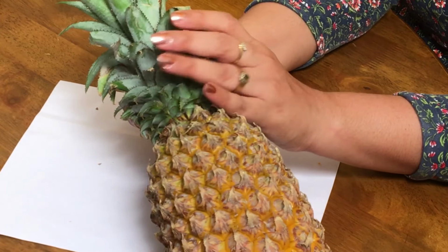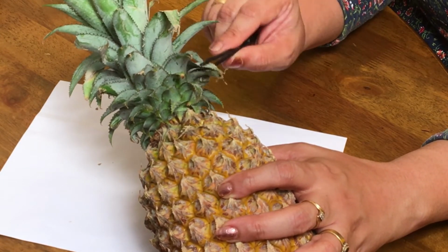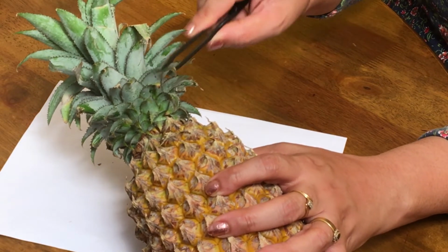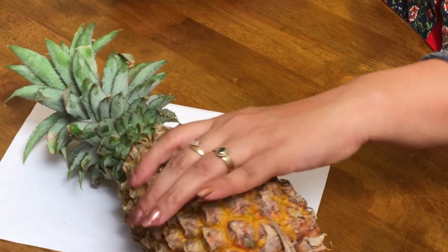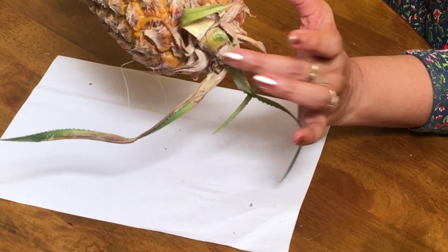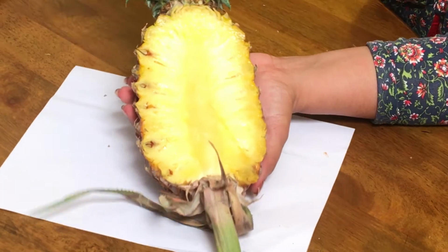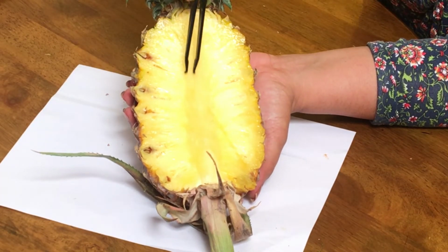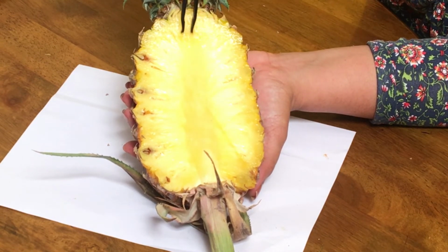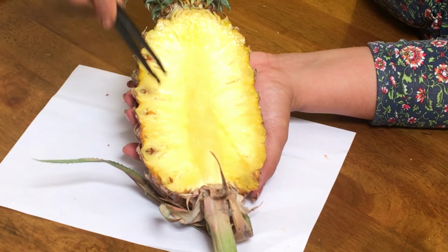Okay. Now what is this part? This part is a crown of pineapple, which is basically the bract of the inflorescence. The green, this is not a leaf, this is a bract of inflorescence, tiny leaf like structures. And this one which you can see here, this is the axis, peduncle of the fruit. As you can see here, this center part which we generally don't eat, this is the axis of inflorescence on which separate flowers will be there.